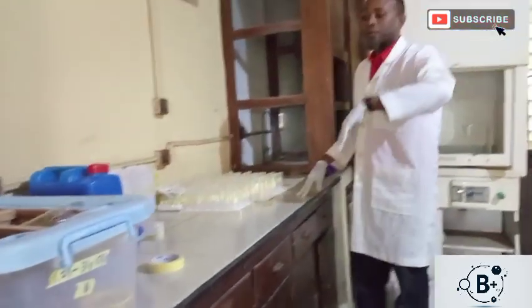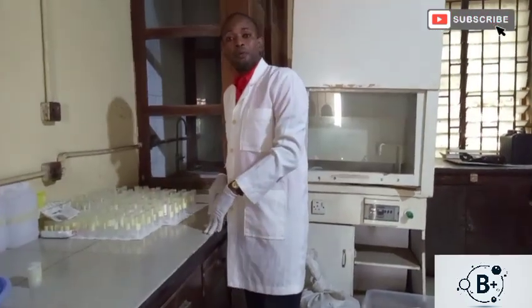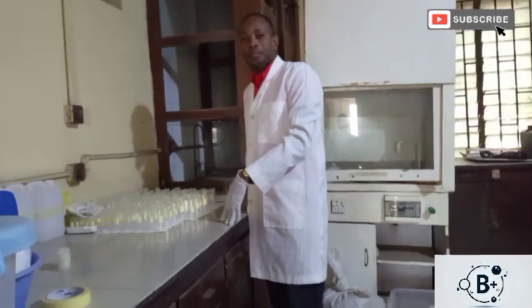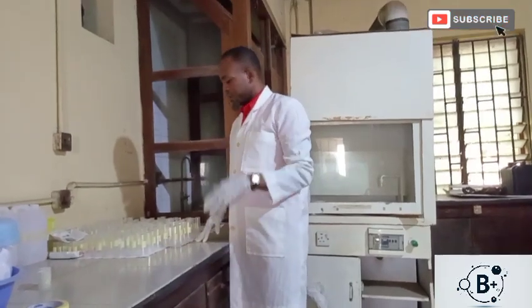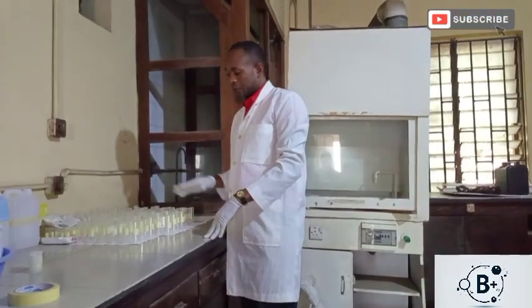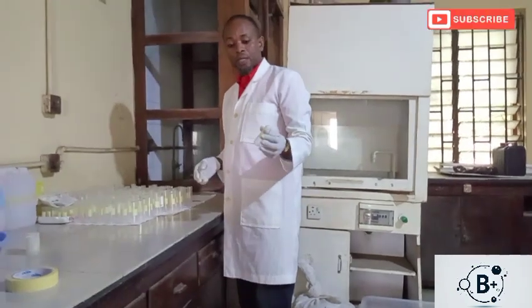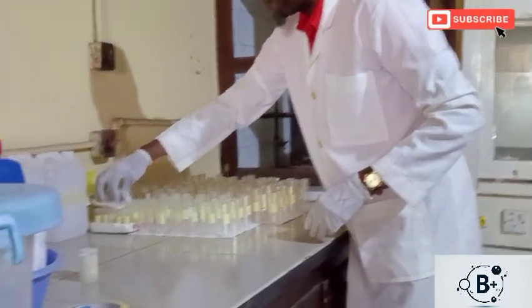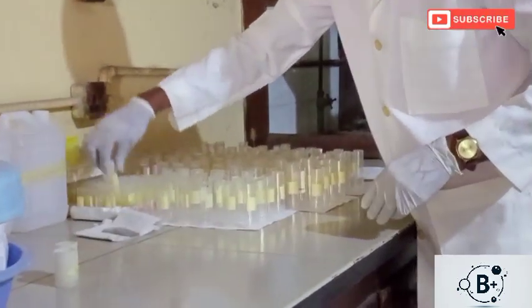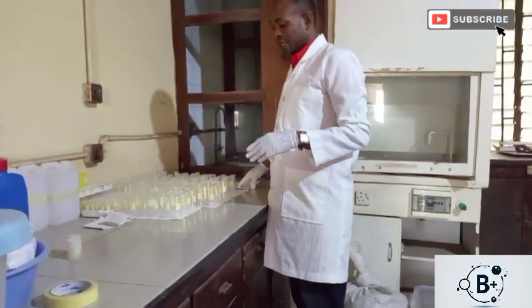So for instance, if you are using rodents like mice for your animal models, at the end of the treatment period, at the end of the treatment duration where you have administered all the treatments required, you will need to get some vessels ready. So like the EDTA containers, then you will get the capillary containers, the capillary tubes. All of these will be used to get the blood and some other tissues that will be required.